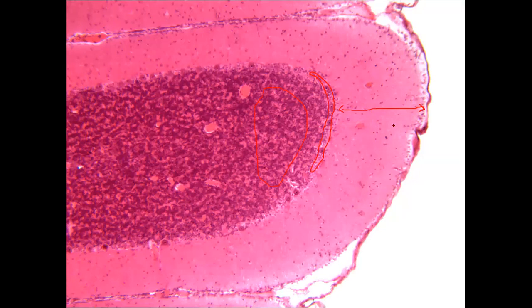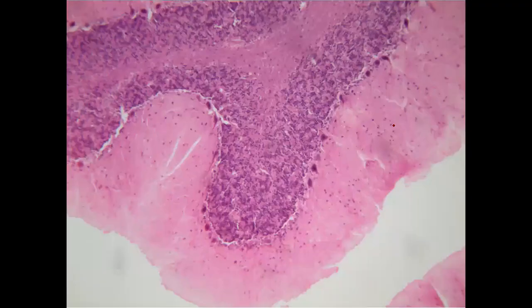As far as points of identification are concerned, you can comment on the layers, the cellular components, and the staining, which area is stained darker compared to the other. You can talk about the single row of Purkinje cells. There are so many points of identification. We'll only ask you about 2 or 3 points of identification of the cerebellar cortex. So this is the slide, and you can easily identify it: if you see three layers, that's definitely cerebellum.